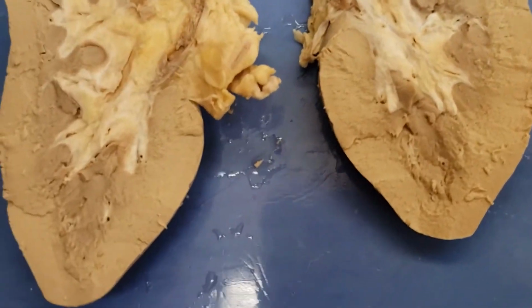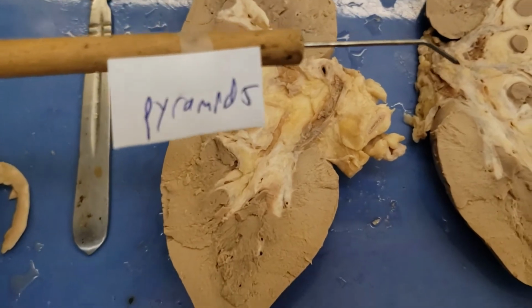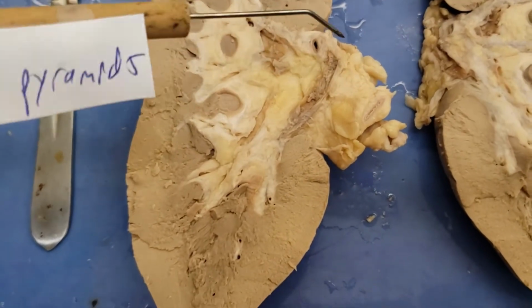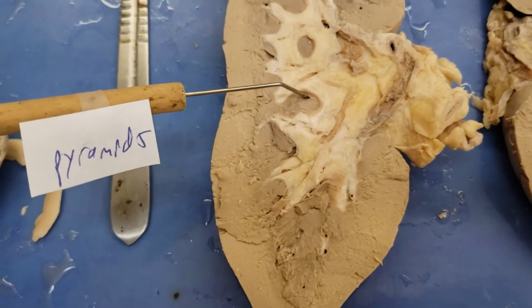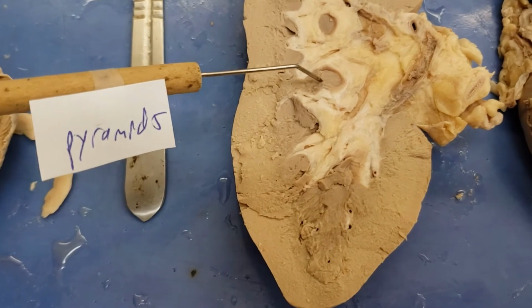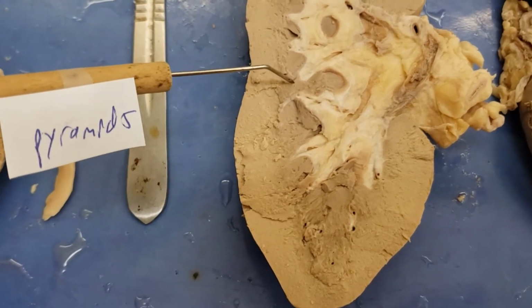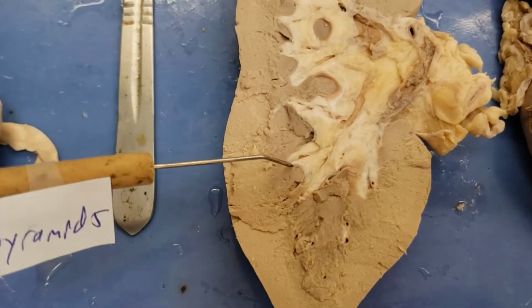But with that in mind, let's look at one of the most important structures in the medulla, which is the renal pyramids. The renal pyramids are fantastic. They have collecting ducts and nephrons in them as well. Long nephrons maximize the amount of water reabsorption and ion, solute reabsorption that takes place. And so that's these structures.